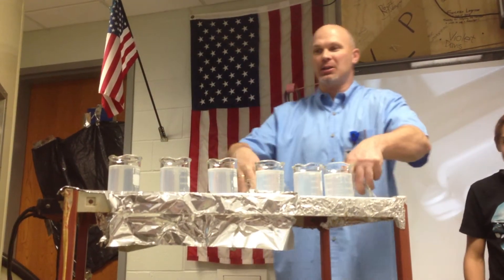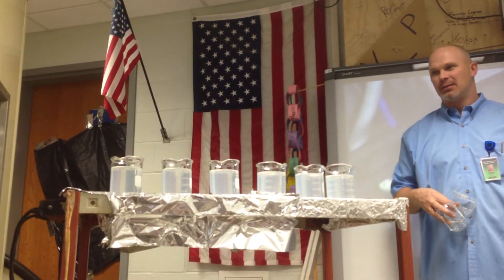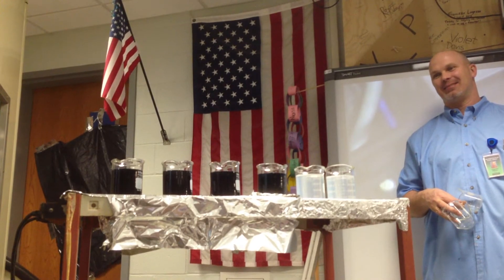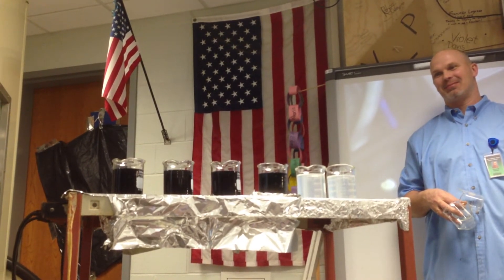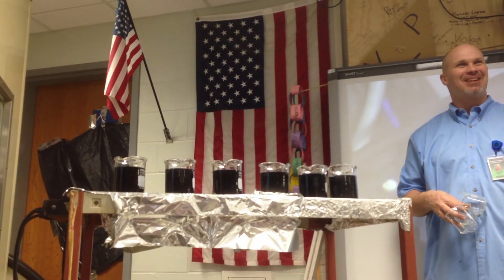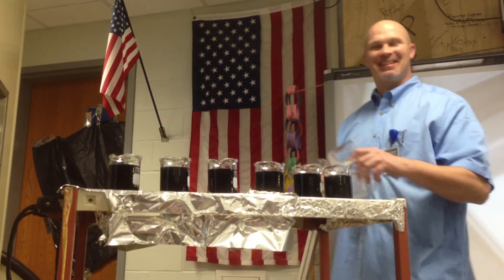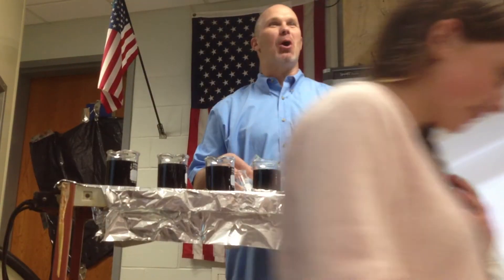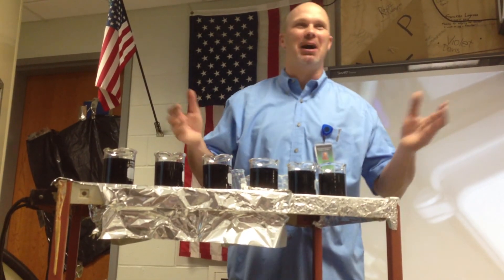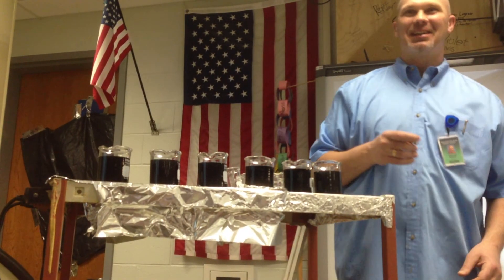We're looking for the more concentrated one to go first. That should be about 15 seconds, as of yesterday. There we go. I wasn't the one to mess up. That was the one where you do a little more. Okay, one year I'll get this — it's not this year. Did we all pour at the same time? No. See, that was probably the issue — we didn't get it all at the same time. You got the idea though. The less concentrated went slower. You need a machine.